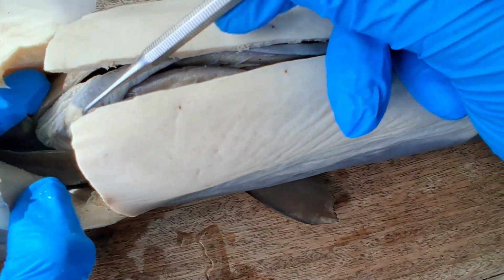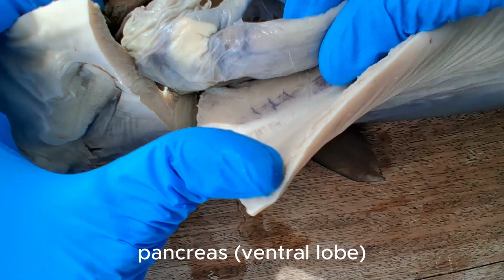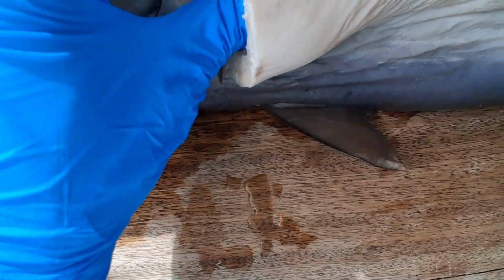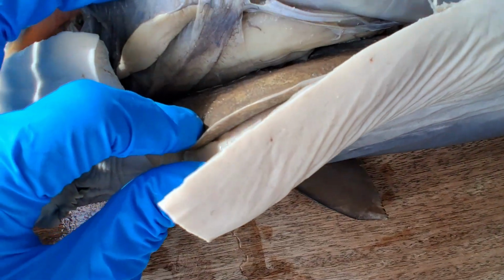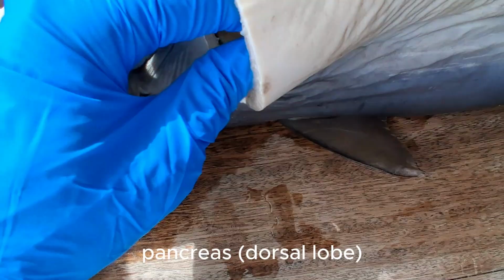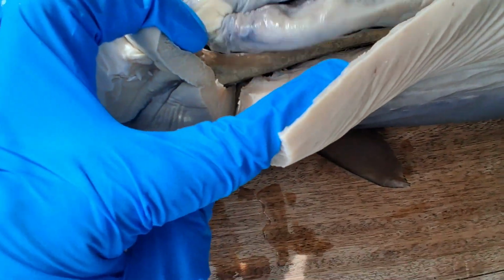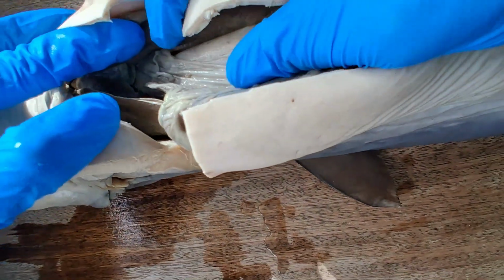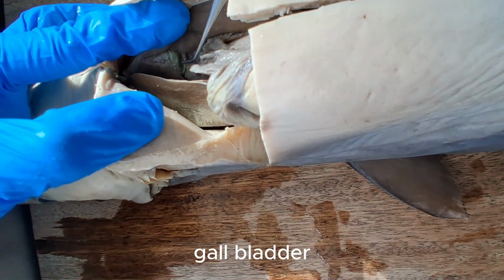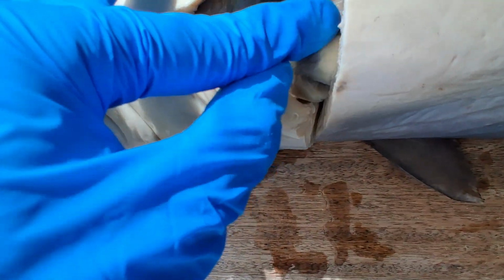This white gland here is the pancreas, adjacent to the spleen. Take a look at underneath. There's another portion of the pancreas. Pancreas. There's a green sac there. Gallbladder stores bile, empties it into the duodenum.